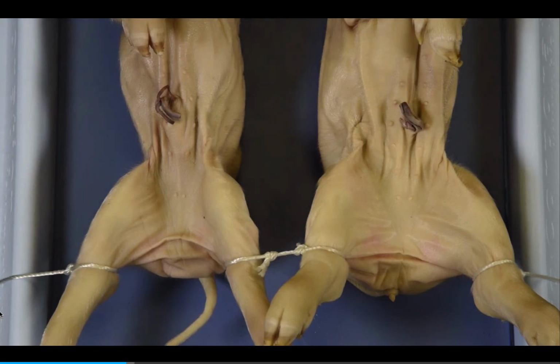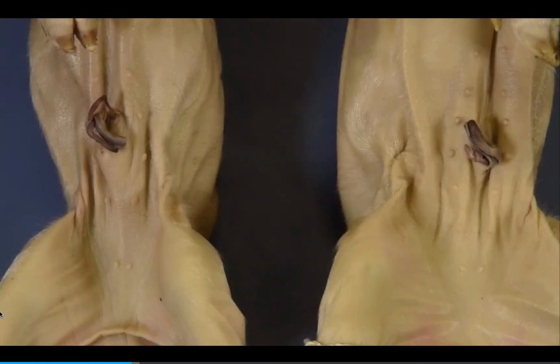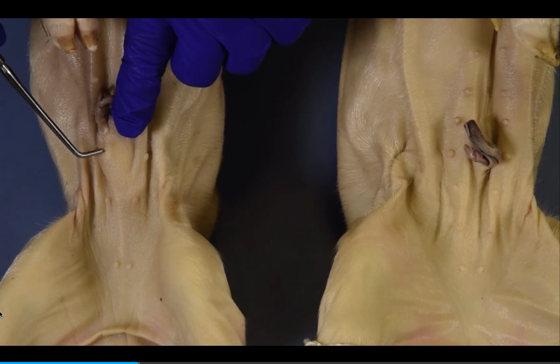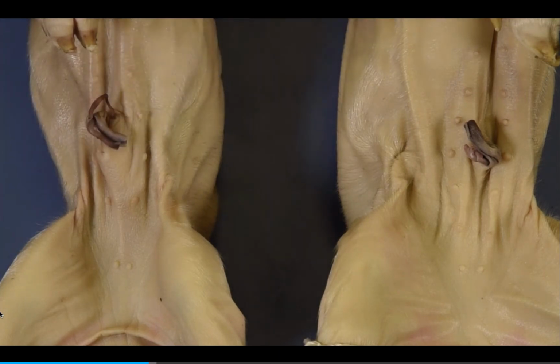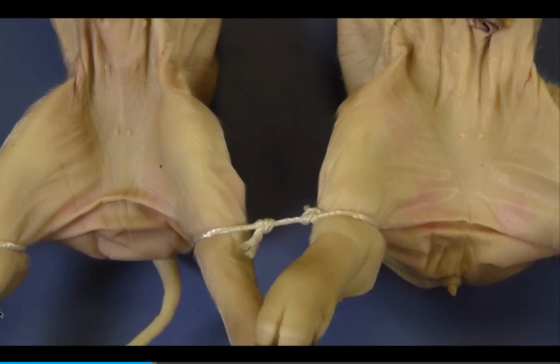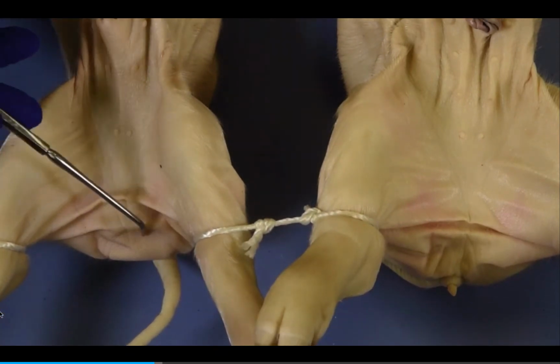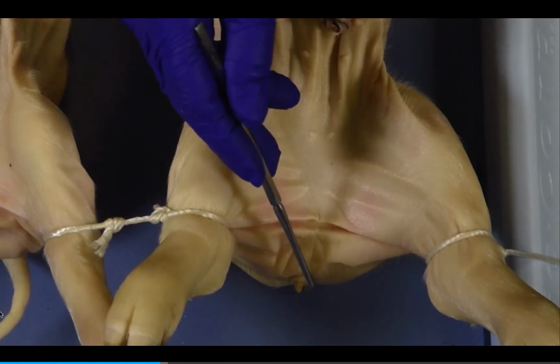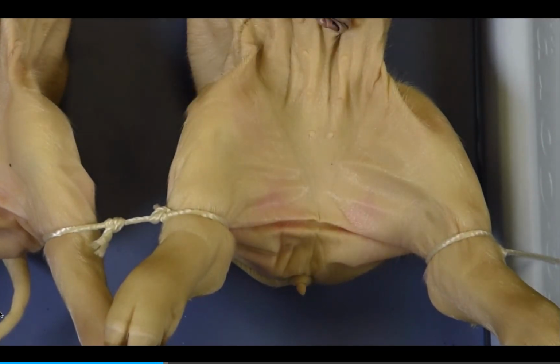Now, let's review the surface anatomy differences between male and female fetal pigs. Male specimens have a preputial orifice, which is the opening to the penis, just posterior or toward the tail to the umbilical cord. This is the opening of the urethra, which releases both urine and semen in adult male boars. Also, the scrotal sacs that will eventually hold the testes appear as swollen regions near the anus. Female specimens have a protrusion just in front of the anus called the genital papilla. This is a common opening for the urethra and the vagina of sows.